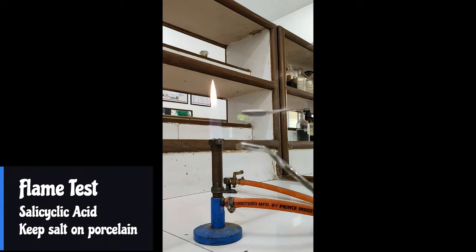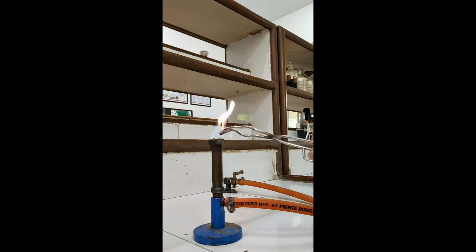Also, if you want to see the sooty flame, you can take a larger amount and keep it on a porcelain piece so that your substance directly gets heated in the flame.